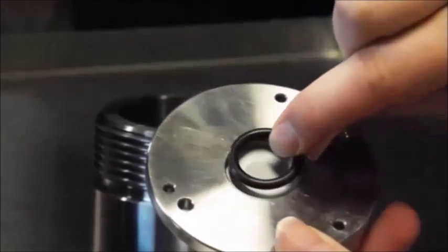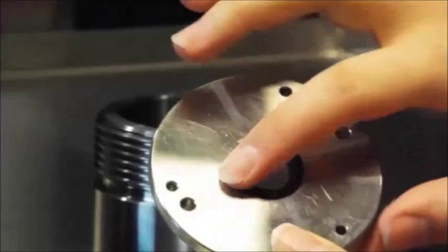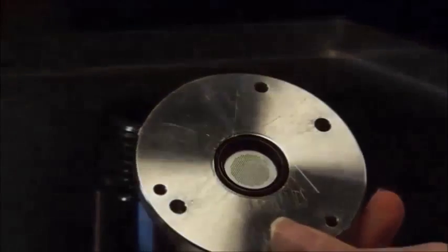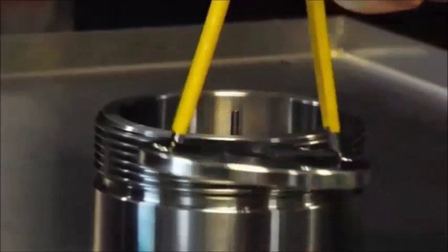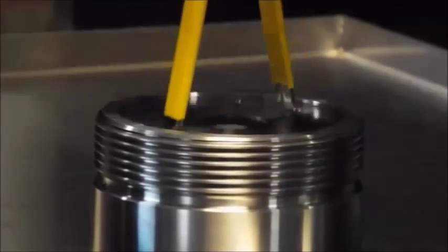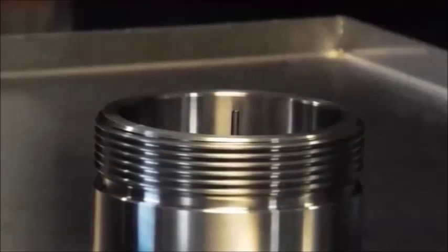This is the O-ring to make sure you get a good seal. It seals down against the sample and then also is able to push out against the sides of that adapter plate. These tongs allow you to insert the sample adapter plate without damaging anything. Pins in the sample chamber keep everything aligned when you put the screw top on.